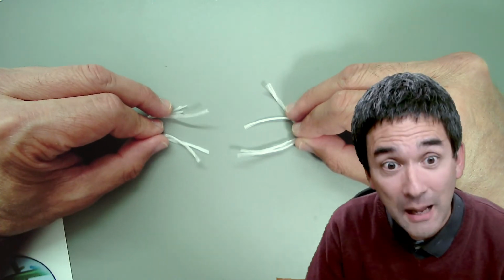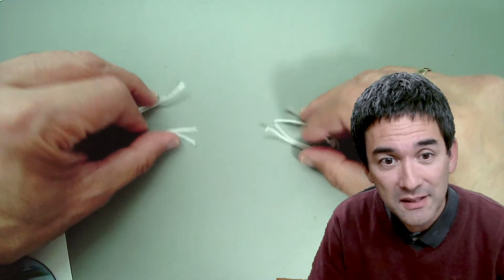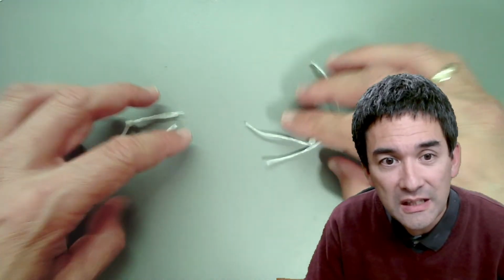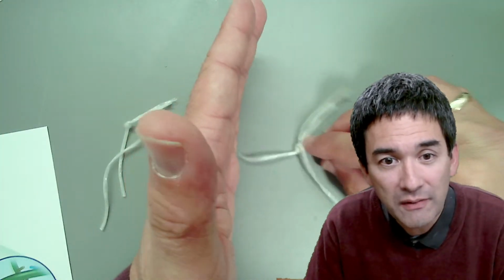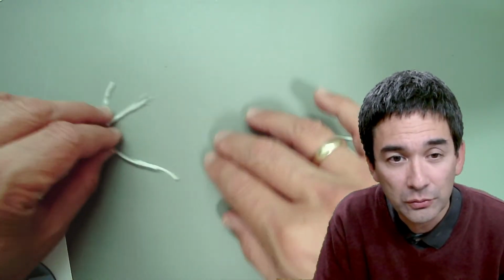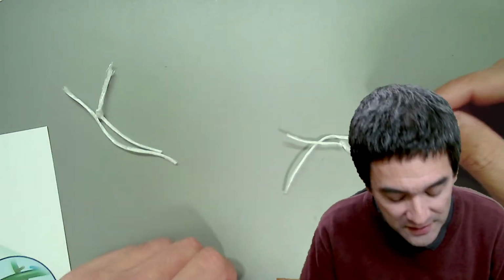And after that has happened, we have separated the identical DNA. Then both of these chromosomes will disappear again. They will form loose DNA again, and then the cell is able to divide. Then you have one cell here on the left and one cell here on the right, and the whole cycle starts again. So these are all of the stages here.